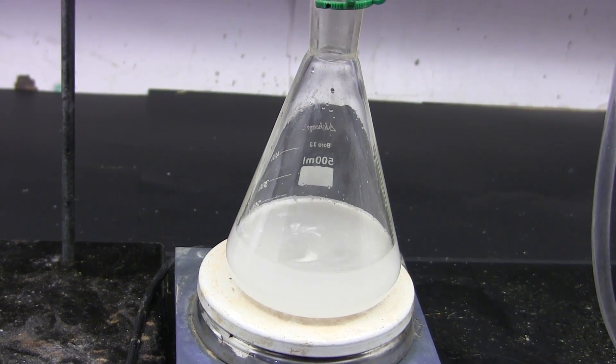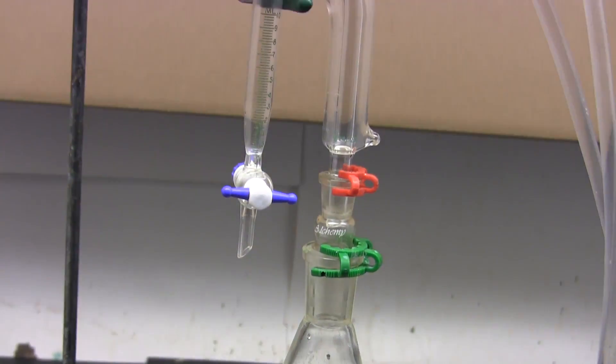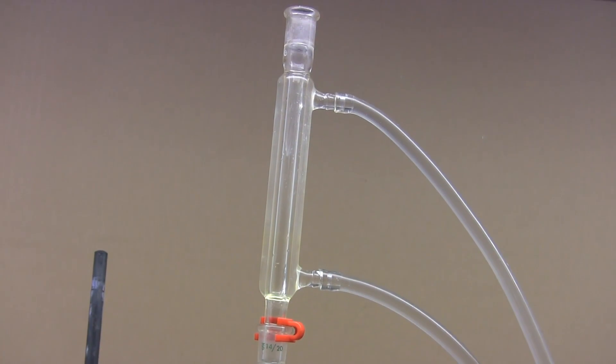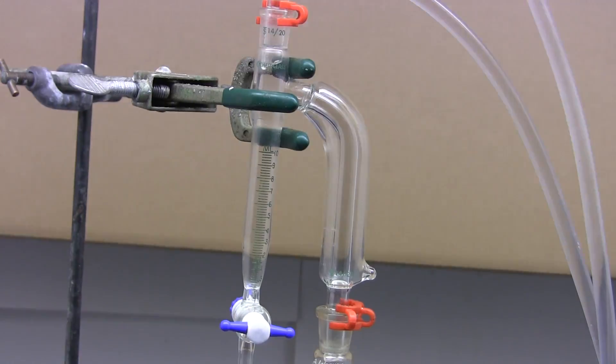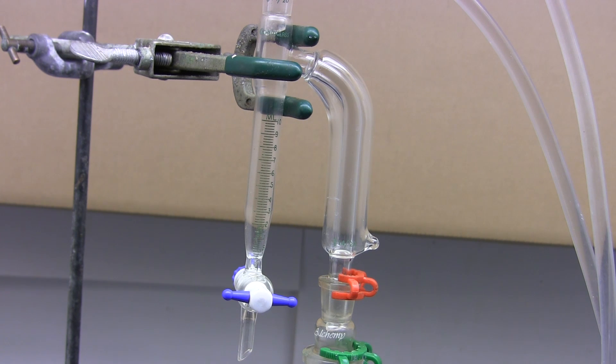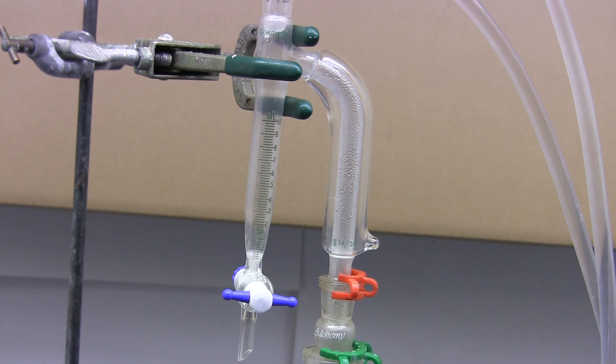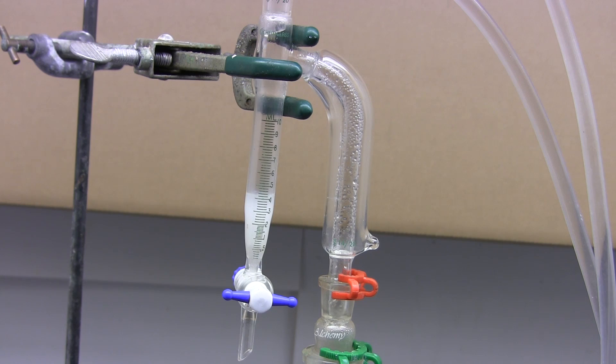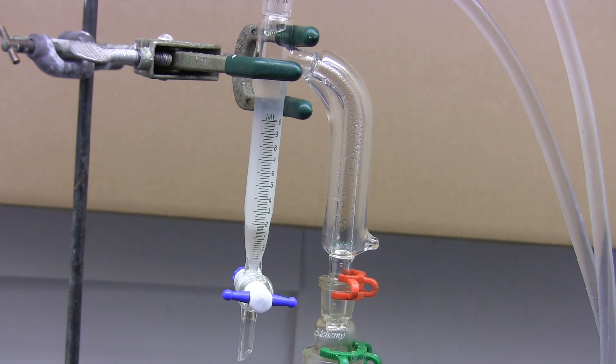Here I have set up a boiling flask containing a mixture of water and toluene. And up here is the condenser. It's all extremely simple to use and set up. Now all we have to do is turn on the heating. And there it goes. The azeotrope of water and toluene is rising up into the trap and condensing in the condenser, where it then falls into the trap. You can already see the layer of denser water accumulating in the bottom of the trap. Eventually when the distillate reaches the top it will overflow and the lighter phase will return to the boiling flask.